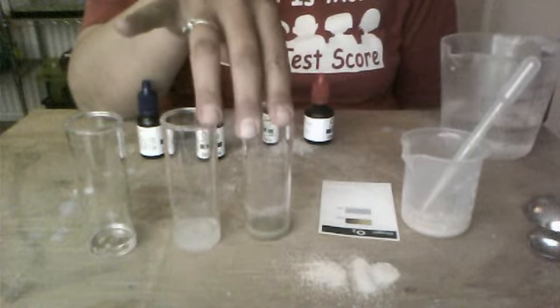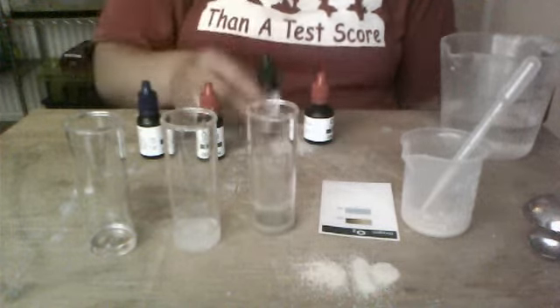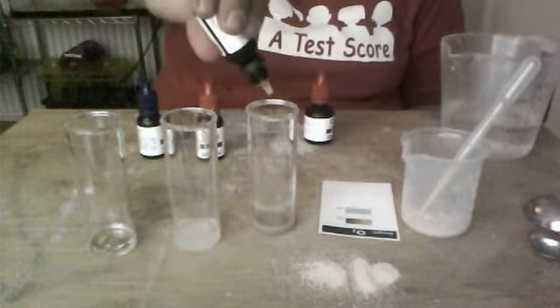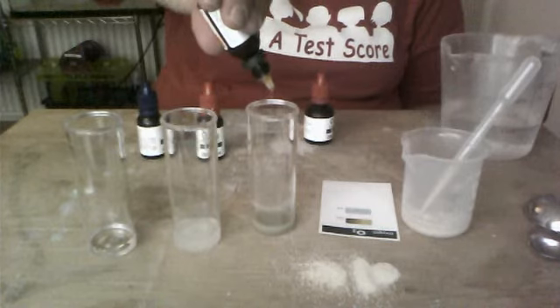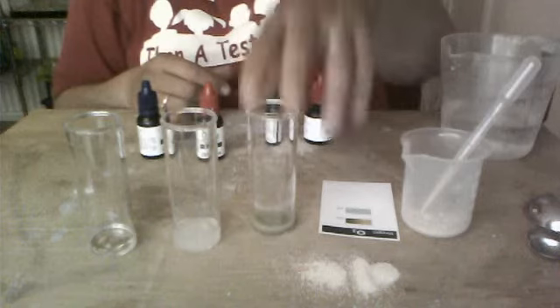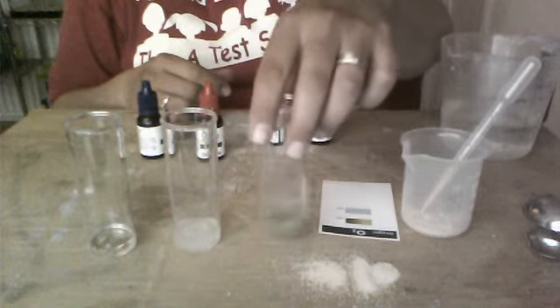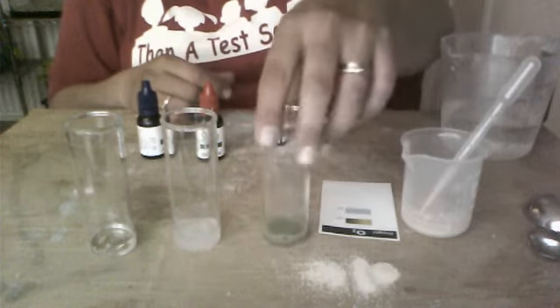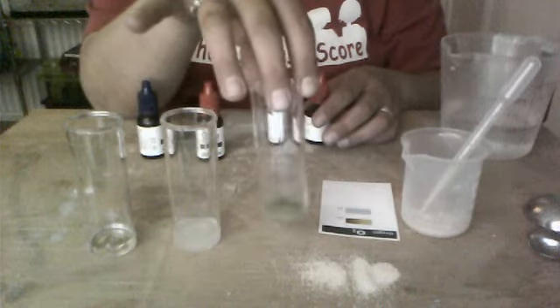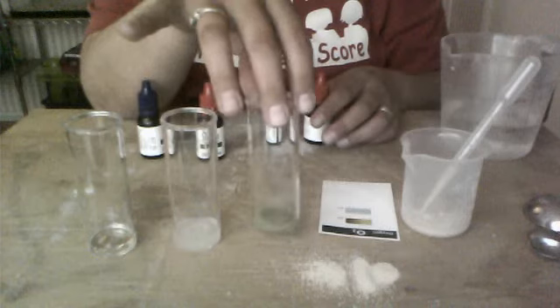And before the break, I had to wait 2 minutes and then add reagent C, which is where I messed up in the first part, 5 drops. And the solution has turned blue already without me adding any of reagent D. So this means that there was no oxygen left in this tube because all the yeast had drank it up.